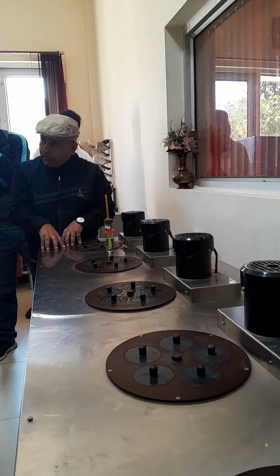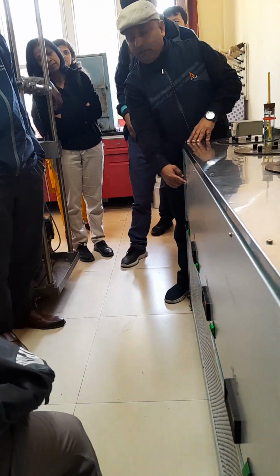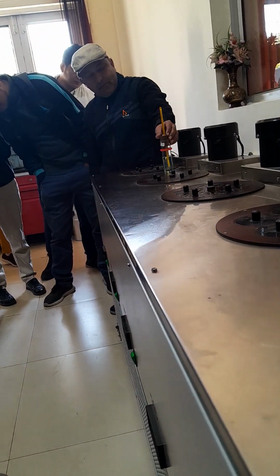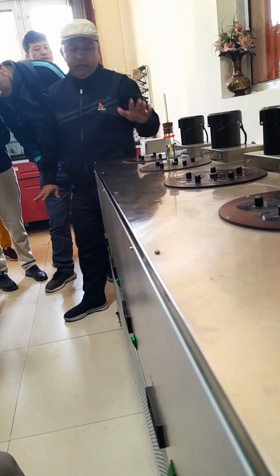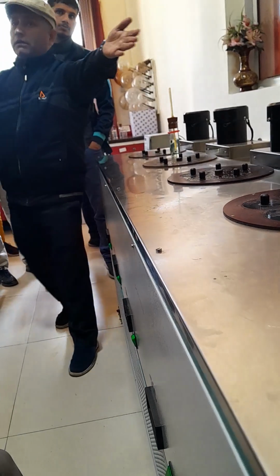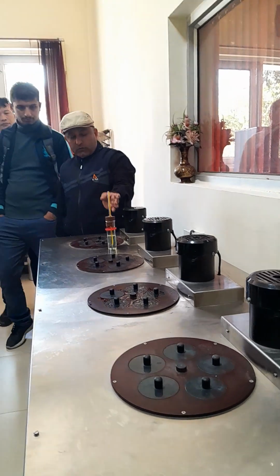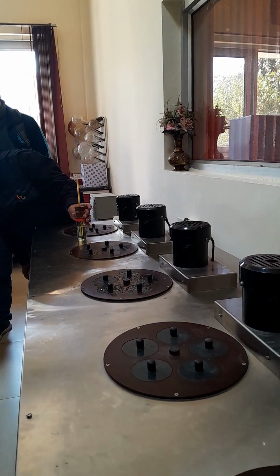First you will start from here, and when your thermometer temperature reaches +9, because bath temperature is -2, it will go down only up to +9. When you see +9 on the thermometer and there is no seizing there, then you will have to shift to the second chamber, then third chamber, then fourth chamber, then fifth chamber. It is not that you directly put it in that chamber, otherwise you will get the wrong result. Now cloud point, we will start the cloud point. Maybe the temperature is still not there, this is 6.6.